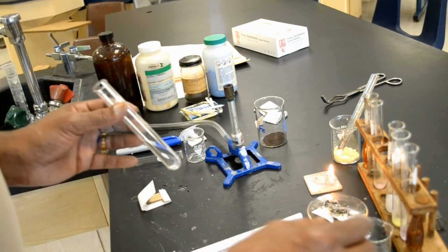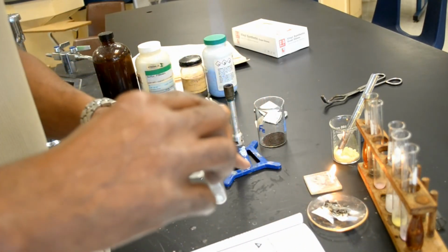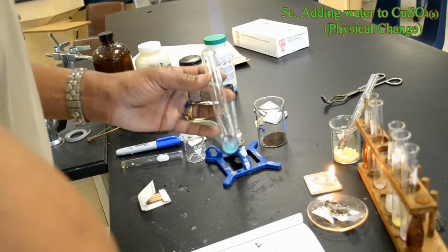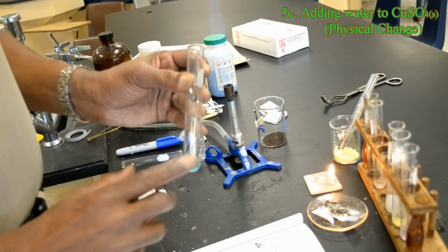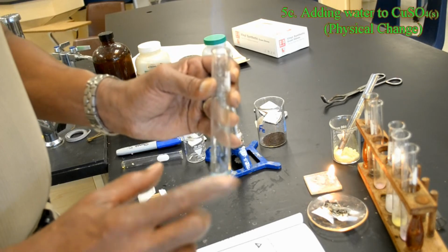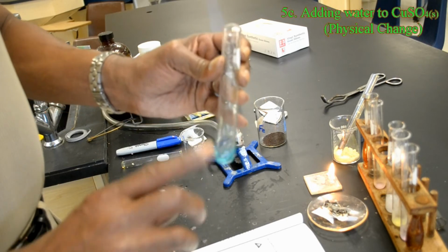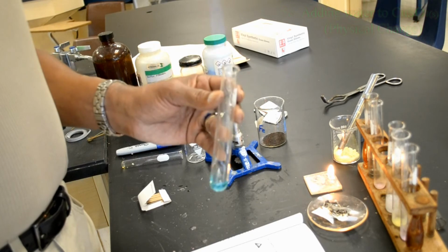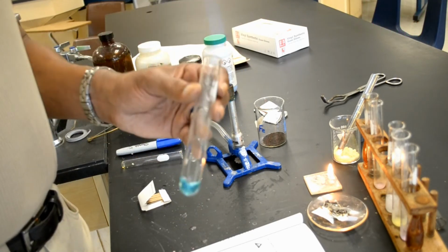However, if I add water to this compound now, as the lab indicates, it said add a few drops of water to the compound. Then the water turns blue, meaning that the copper 2 sulfate is being hydrated again. So this type of change represents a physical change because we could get the original copper 2 sulfate back.